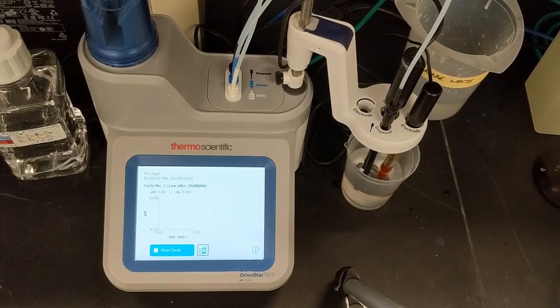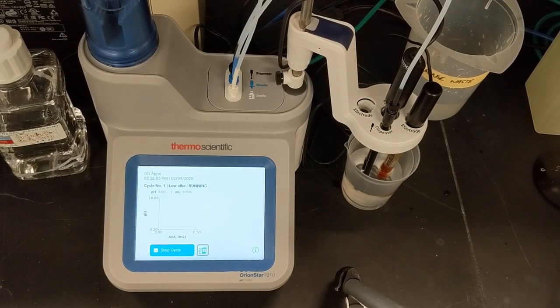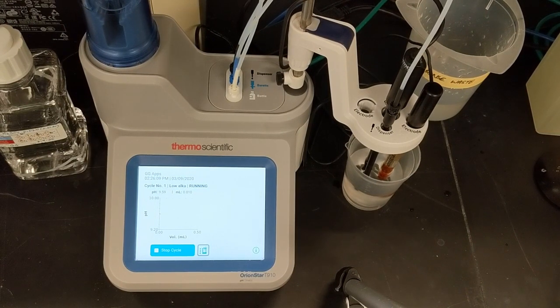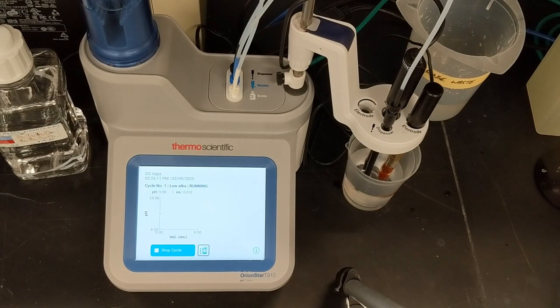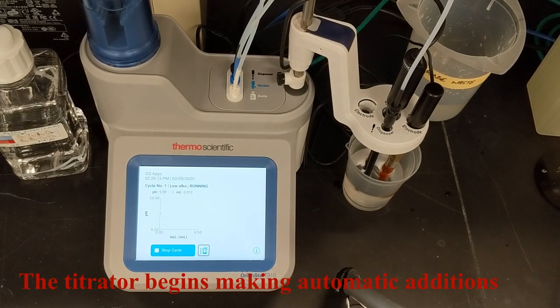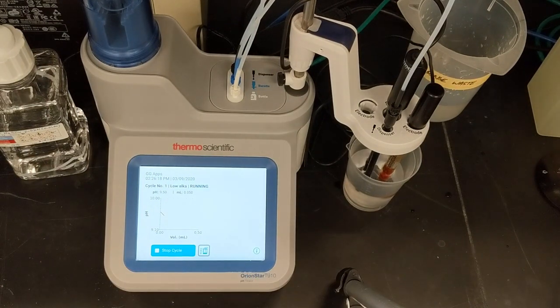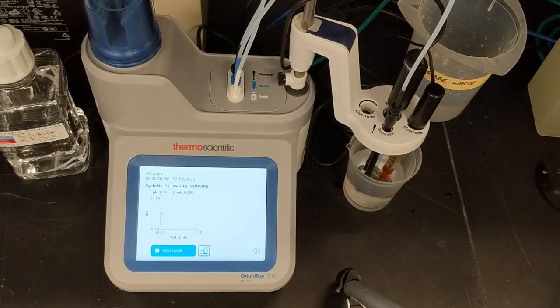Then the titrator begins to make automatic additions of titrant, which I will see happening on screen. Titrant is added, pH is sensed, and the process continues automatically.